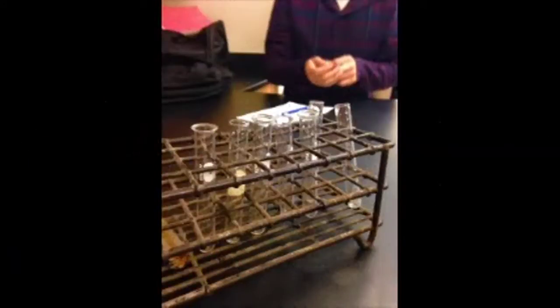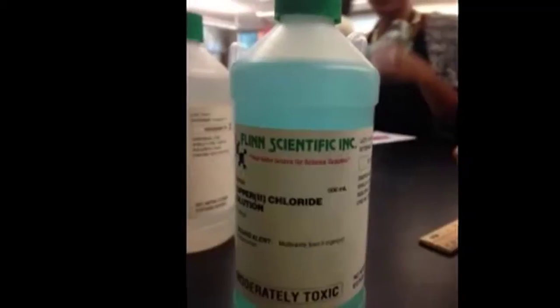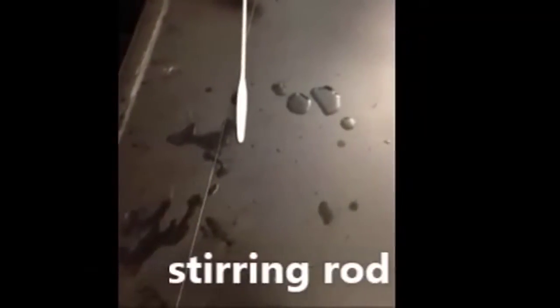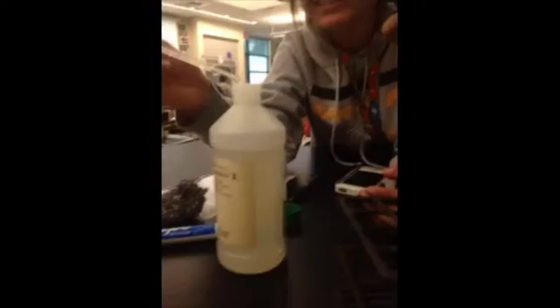Our materials were glass tubes, sodium phosphate, copper chloride, a ruler, pipette, and a stirring rod. The method we used was by dropping a certain amount of drops of sodium phosphate and copper chloride to each test tube.